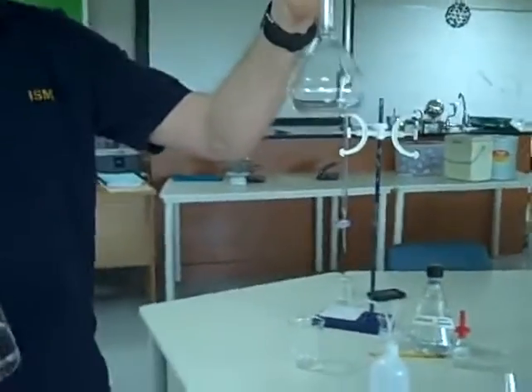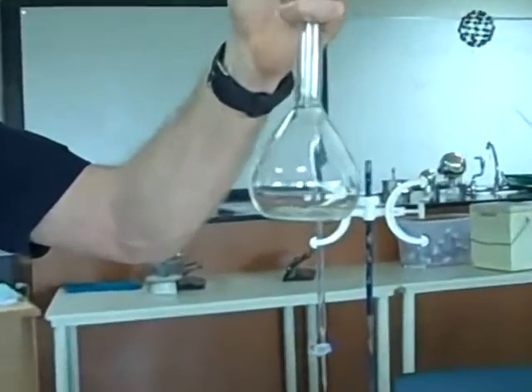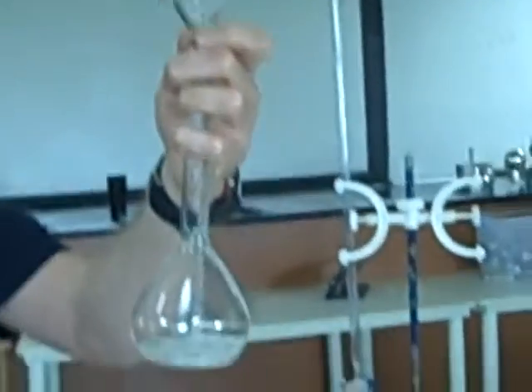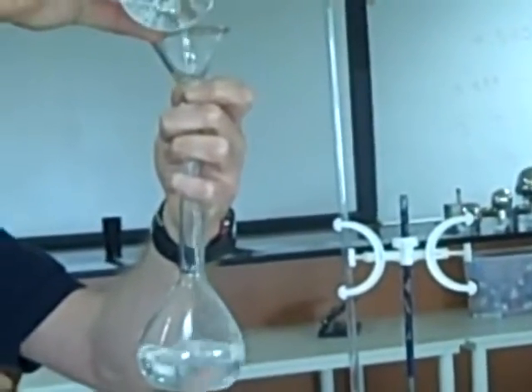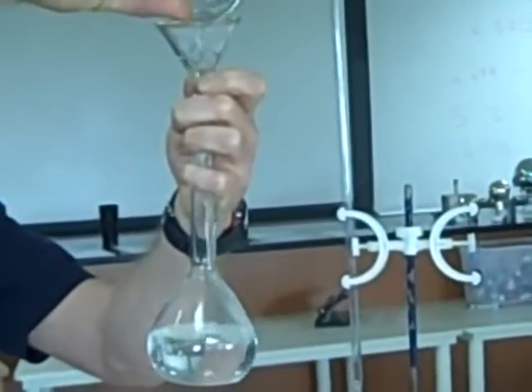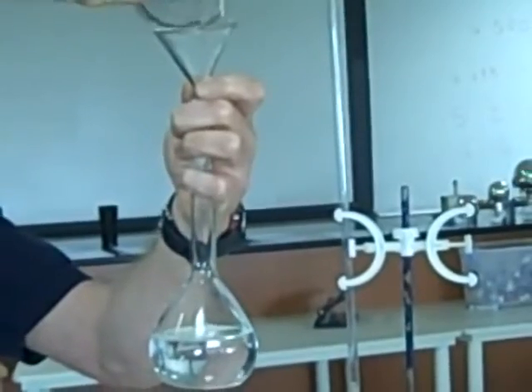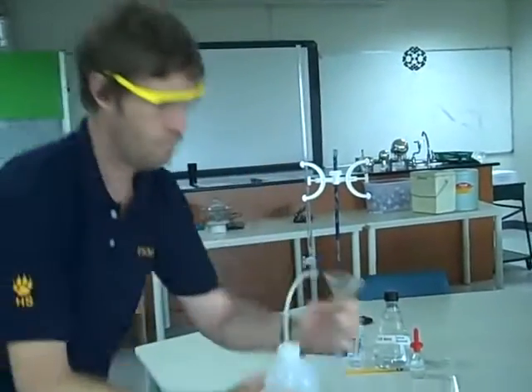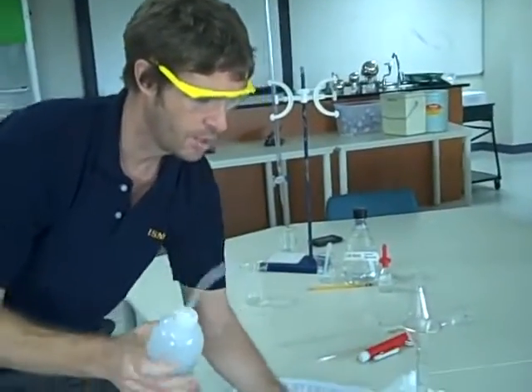Then hold the funnel up. Don't let it sit down, otherwise you end up spilling. Hold it up a little bit and then pour your solution into here. Like so. And again, we are going to rinse. Remember, now there's some oxalic acid solution in here.